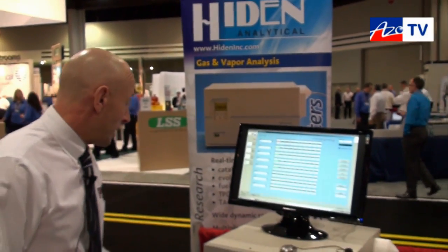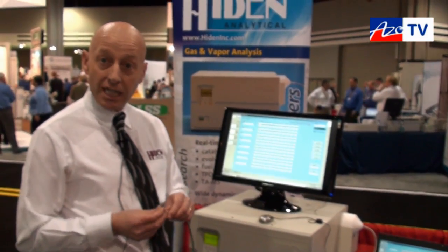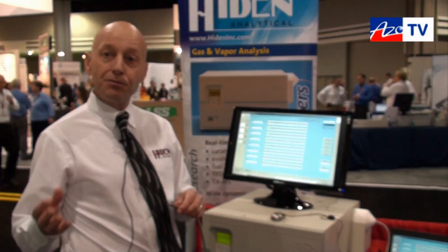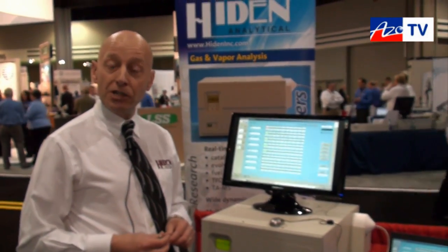As for inlet options — one of the most common applications for this instrument is to interface it with thermogravimetric analyzers. We're proud to work with some of the leading TGA manufacturers, and we've designed dedicated interfaces that attach this capillary with great integrity to TGAs from companies such as Perkin Elmer, TA Instruments, Netzsch, Setaram, and many other world-leading TGA suppliers.